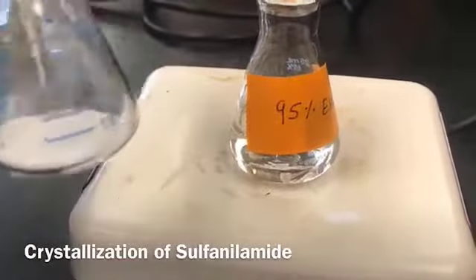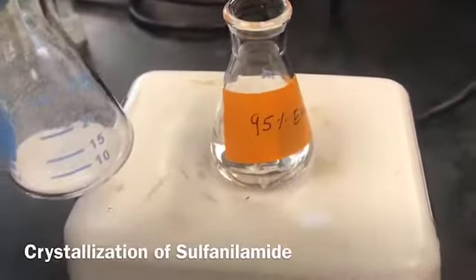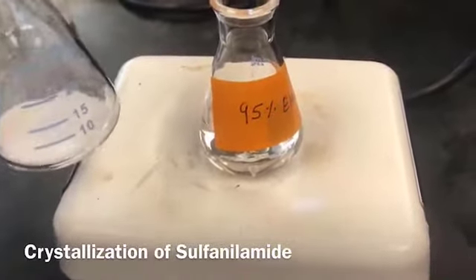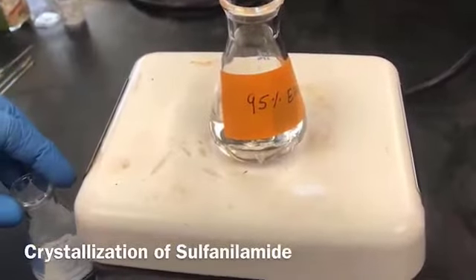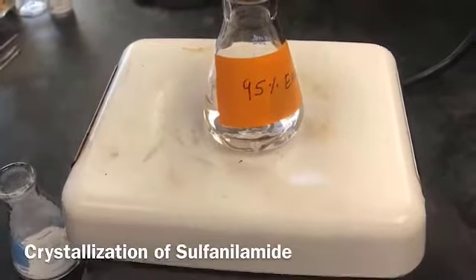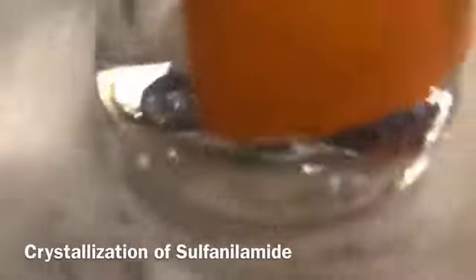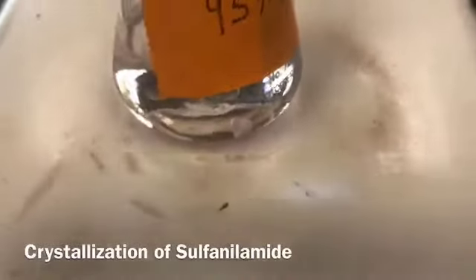Then I'm going to swirl it, try to dissolve it, and then at intervals I'm going to add 0.5 milliliter at a time, again swirling, dissolving, swirling, dissolving, so that I have a minimum amount of the crystals in the boiling solvent. As you can see, I have added a boiling stone here, which will prevent bumping and superheating. So it is a must to add the boiling stone.